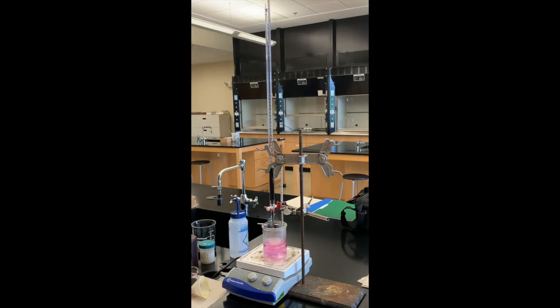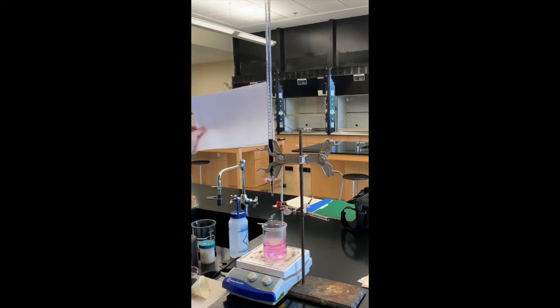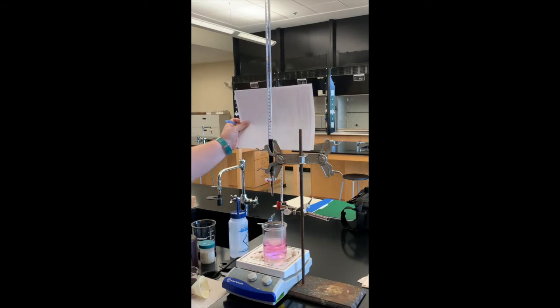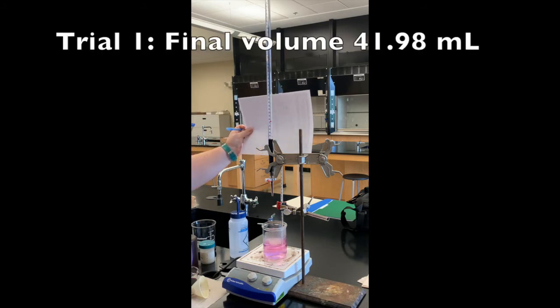Okay, so we are at our endpoint, so I'm going to read the final volume in the burette and then I'm going to refill it for our next two trials. The final volume here is 41.98.